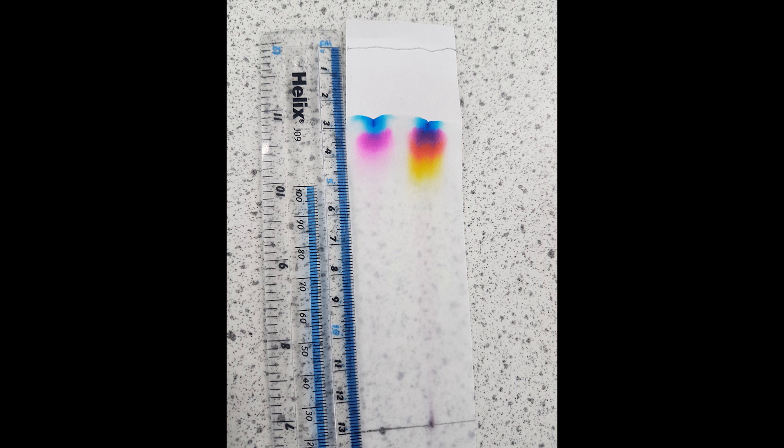Now as you can see, right at the top of my chromatography paper I've penciled off where the solvent stopped moving, so that's where we got up to in terms of the water. So I got pretty much to the top before all the colors had separated as far as I could tell. Now so what I'm going to do: number one, I'm going to record the total distance. That's the distance from the bottom pencil line to the top pencil line. That's the total distance the solvent moved. In this case, if you look carefully, I've placed the ruler there, it's 13 centimeters. So my total distance in which the solvent traveled was 13 centimeters.